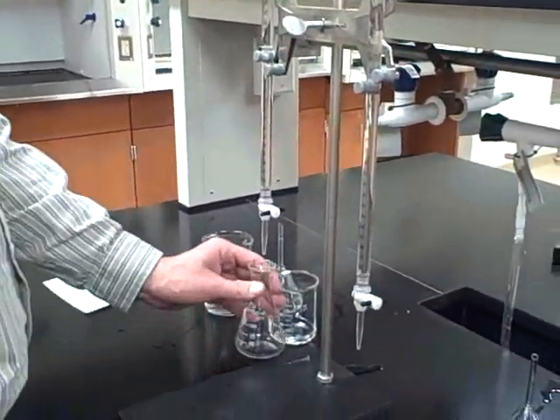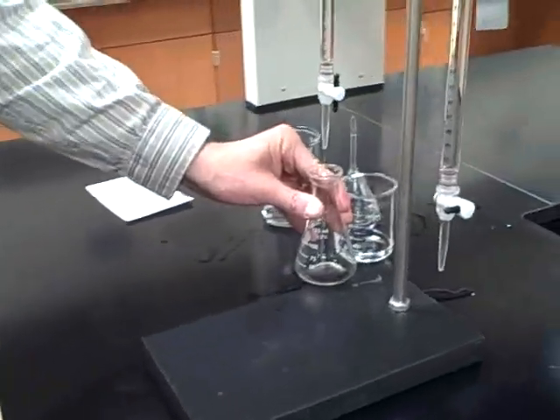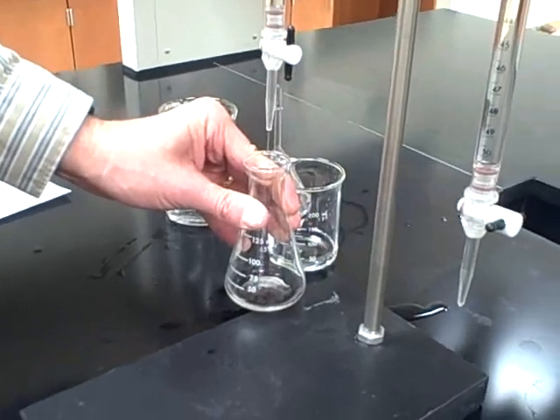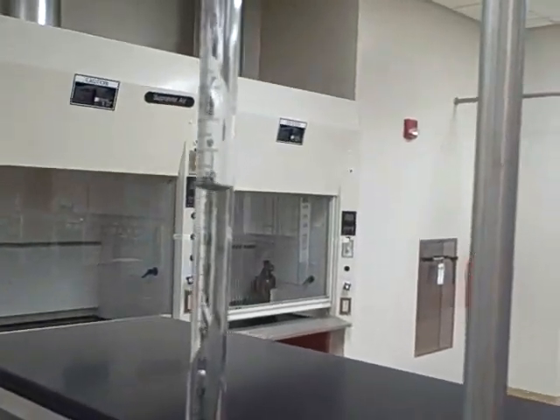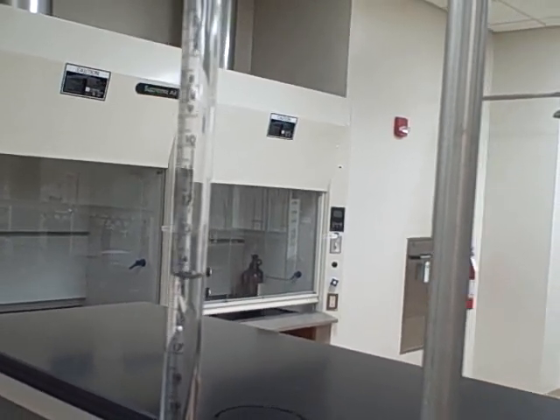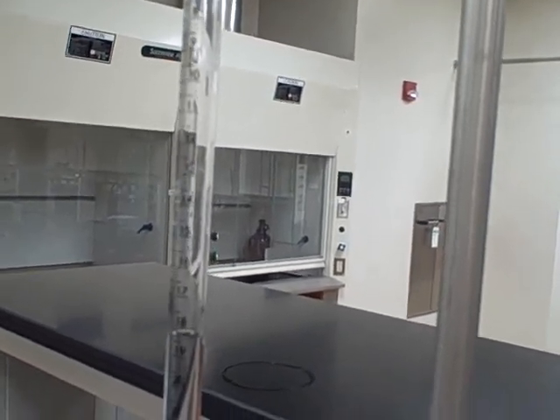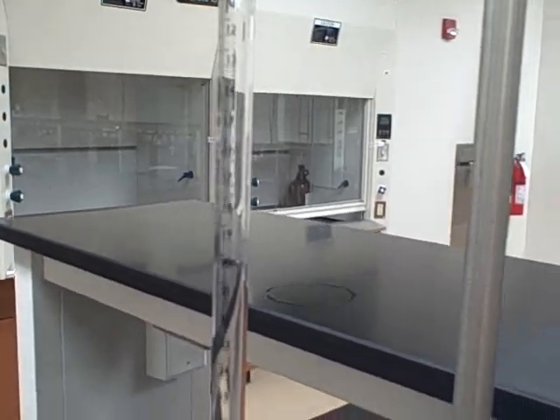The first step is to put about 20 milliliters of acid into the flask. So I'm just going to open up the acid burette and drain in about 20 milliliters — it doesn't have to be exactly 20, but 20 is a good amount. If you use a volume that's very small, like only 5 or 10, you don't get as much accuracy out of the burette.